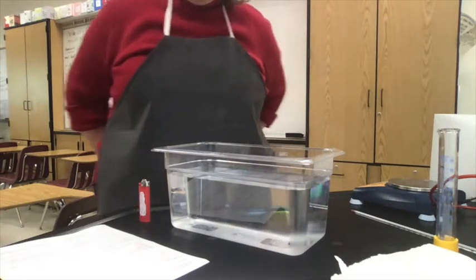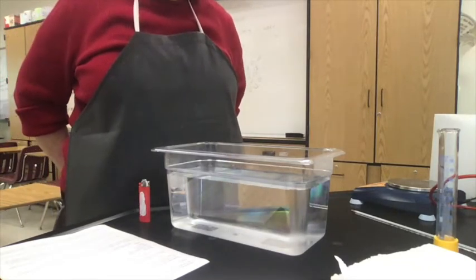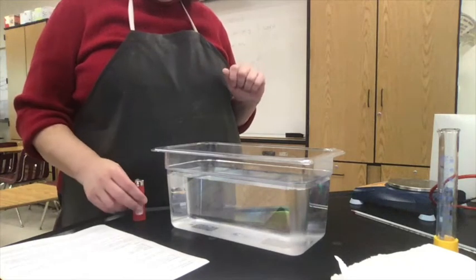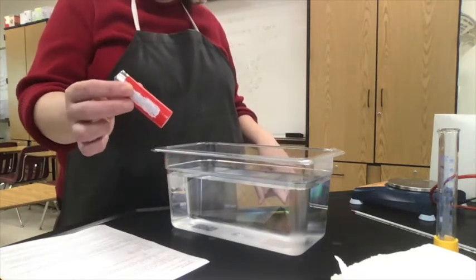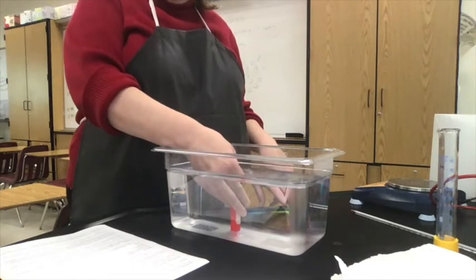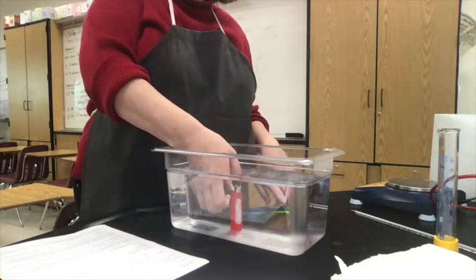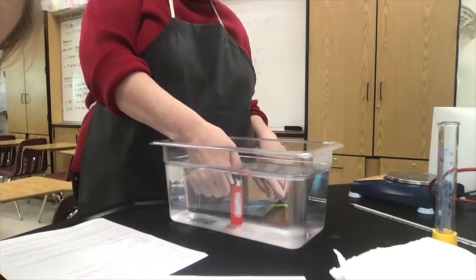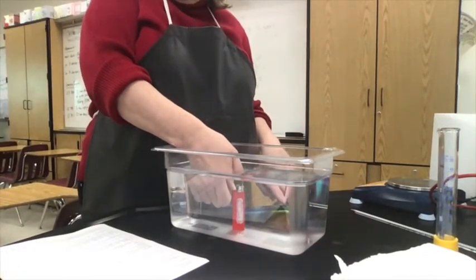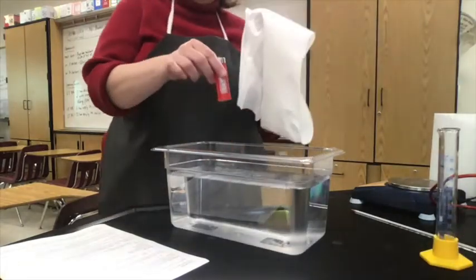I would recommend that you have the procedure handy so you can follow along. I'm going to start here with step number 1, which says take this butane lighter and submerge it in a basin of room temperature water and press the lever. You can see it bubbling up. This step just has to be done once to start the lab, to get water down in the nooks and crannies.